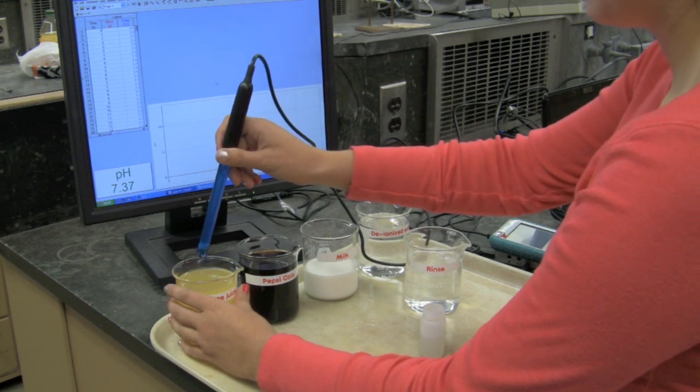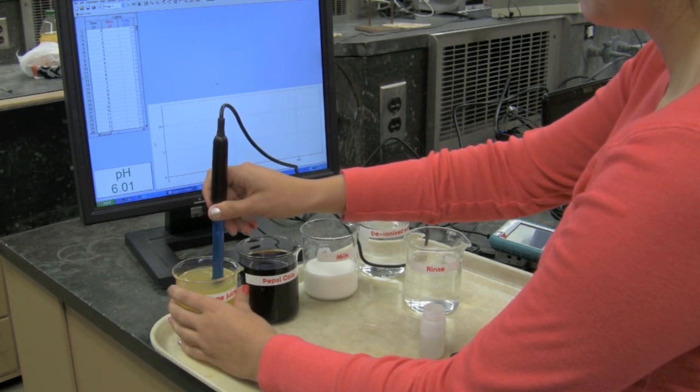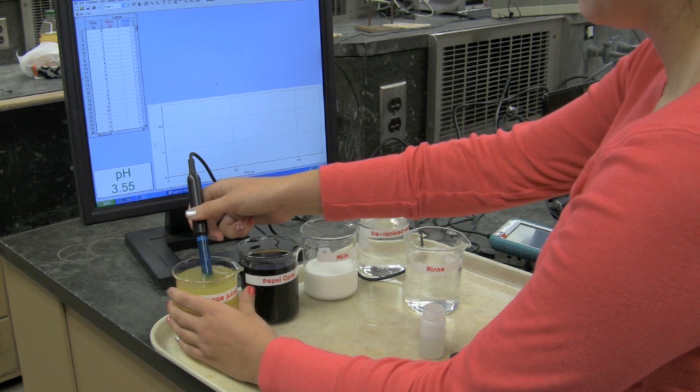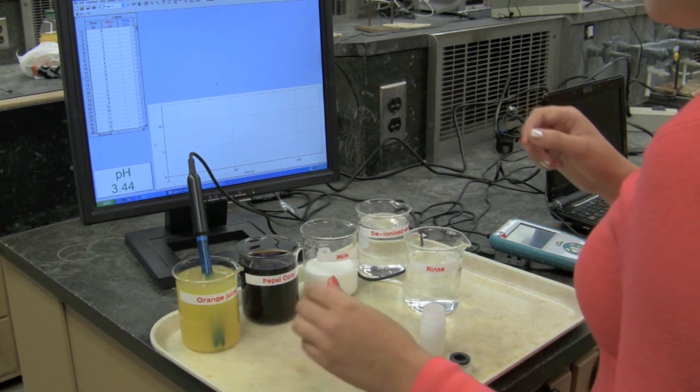She is placing the probe into a beaker of orange juice to her far left. She will record the pH in a Word document and state whether or not it is acidic or basic.